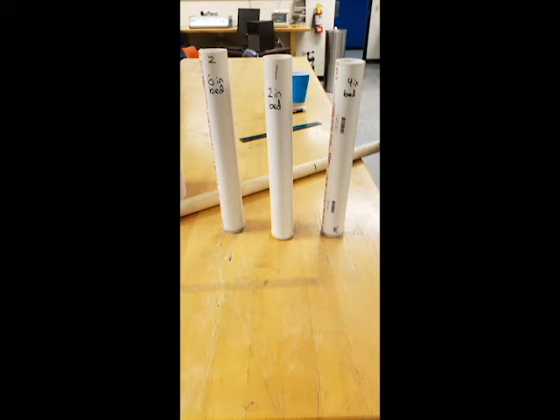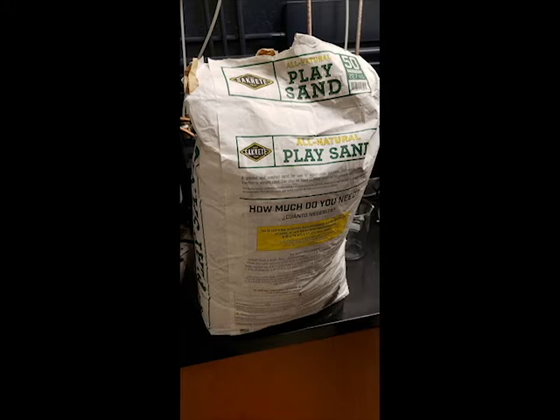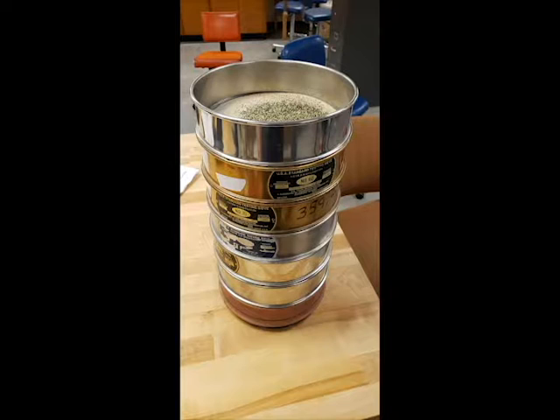6-inch bed. To do this, we bought a 2-inch PVC pipe and cut it into pieces. The activated carbon used was removed from water filters and collected. We decided to use a 10 weight % activated carbon and sand mixture to reduce the amount of activated carbon needed for each column. After the mixture was made, we ran it through a series of sieves to get a particle distribution and calculate an average particle diameter, which came out to be 290 microns.